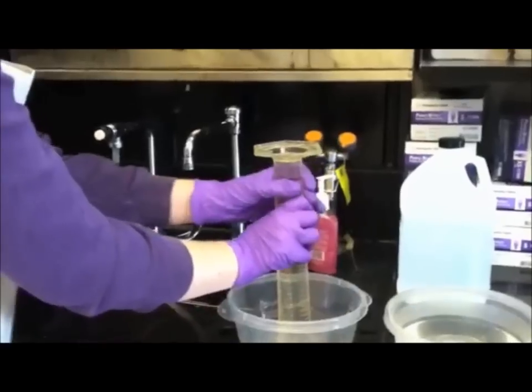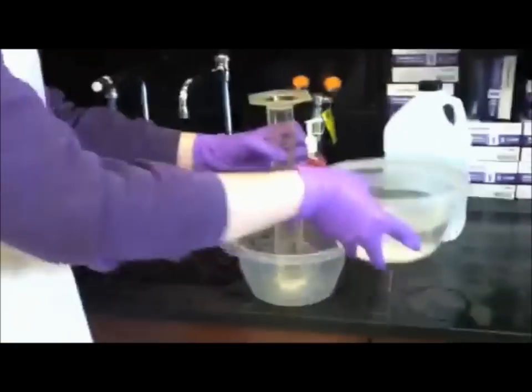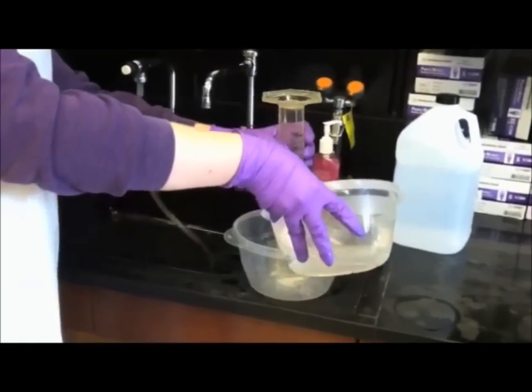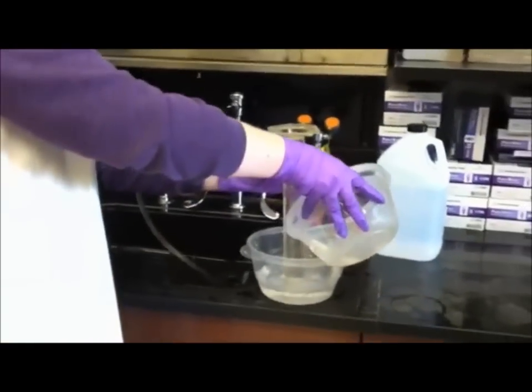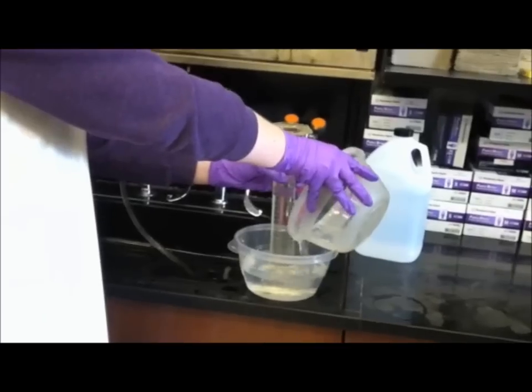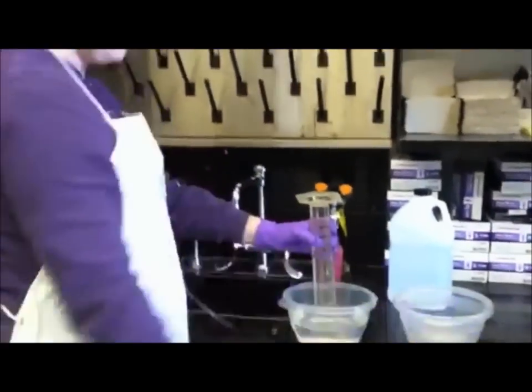As long as it's not huge. And then I've already prepared some other DI water to pour to create a water bath. And that is one way of inverting it.